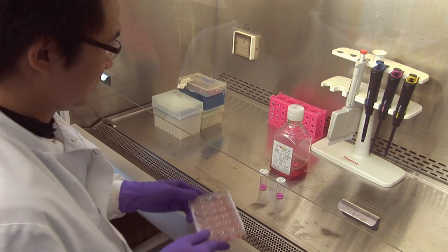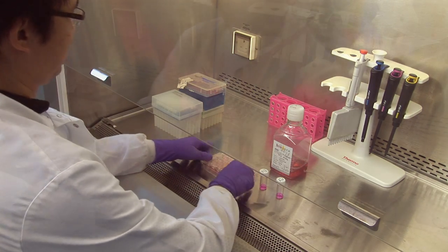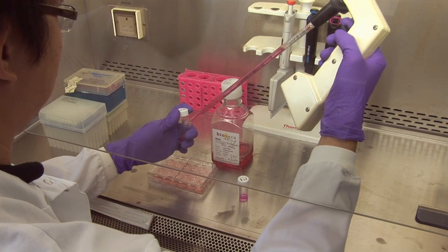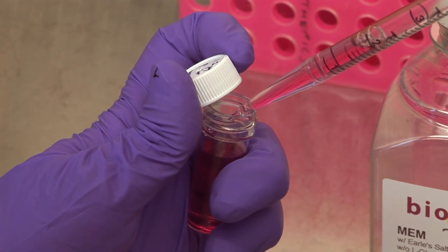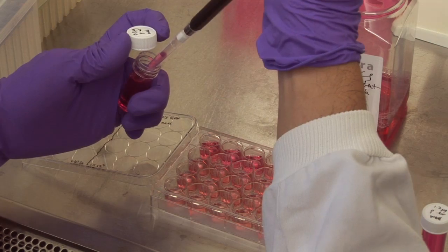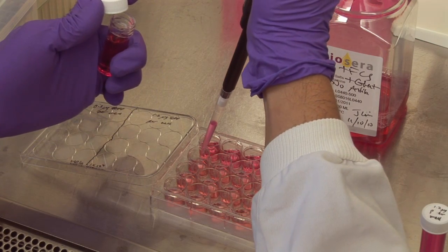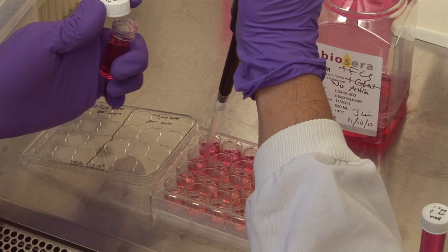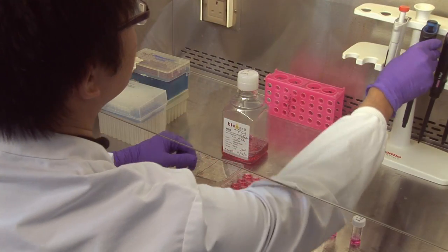After the incubation period, add serum and supplement containing media to the DNA nanoparticle complex to produce the required total volume for transfection. Add the required volume of NT-Mag DNA complex to each of the wells containing the seeded cells.